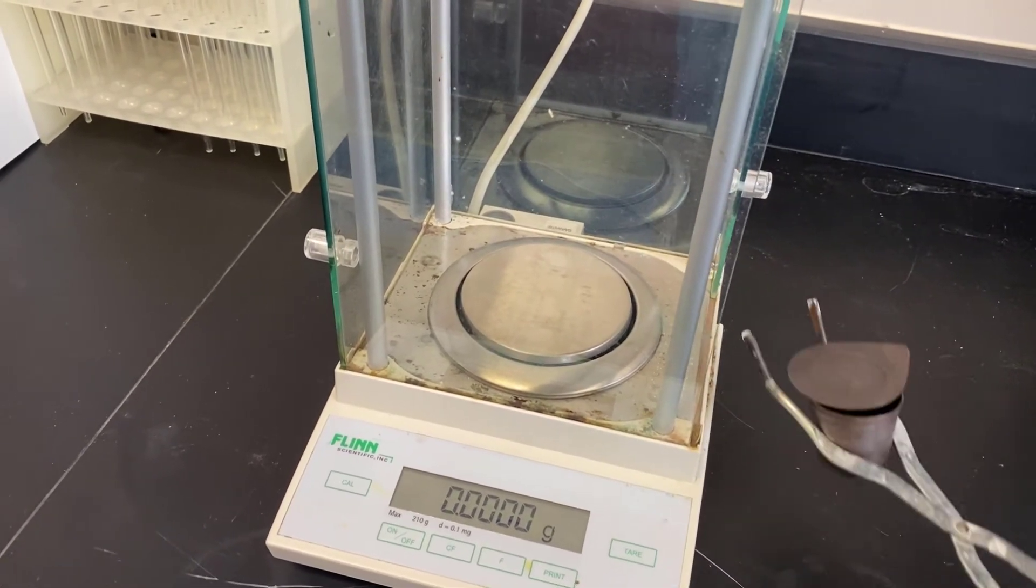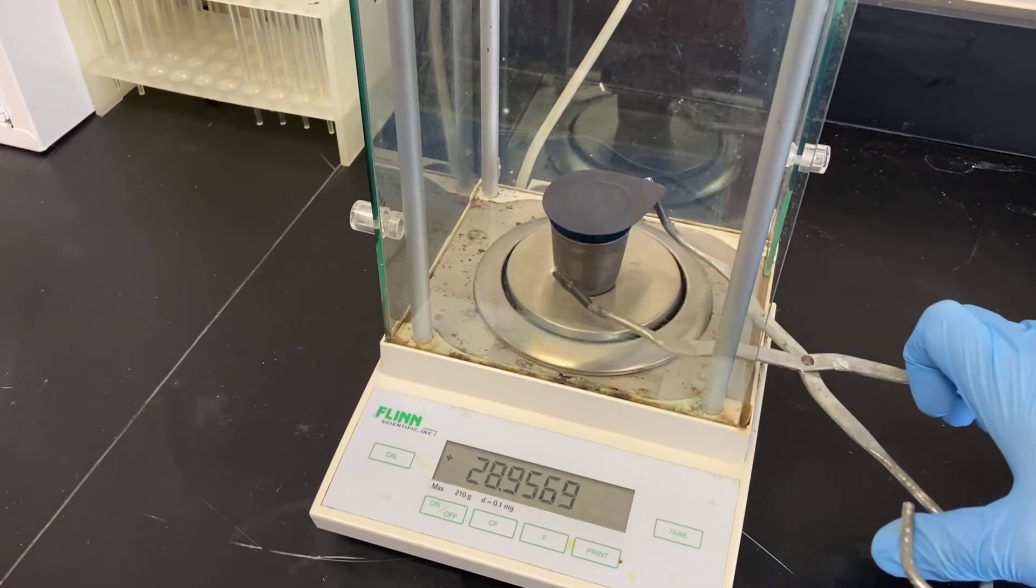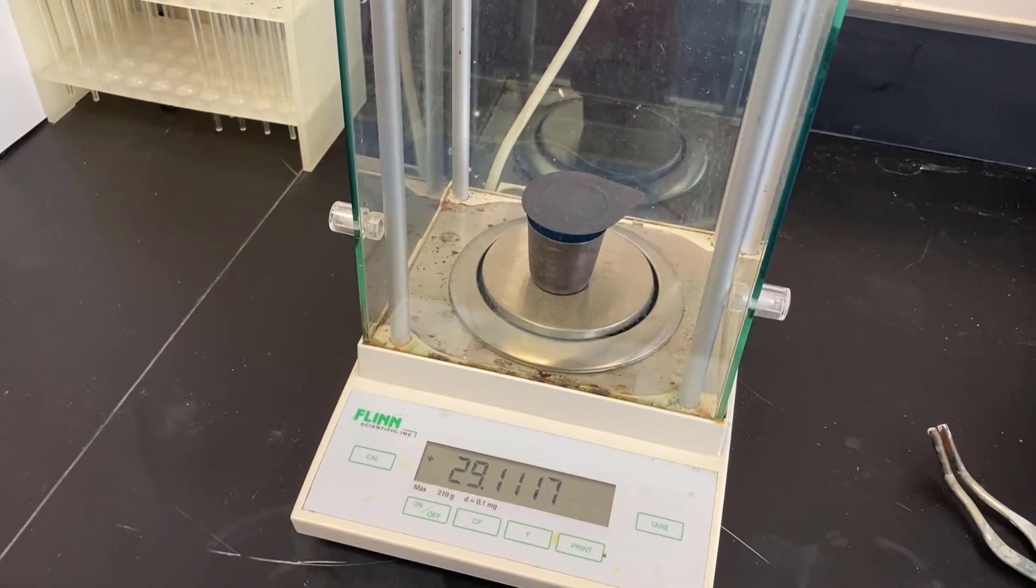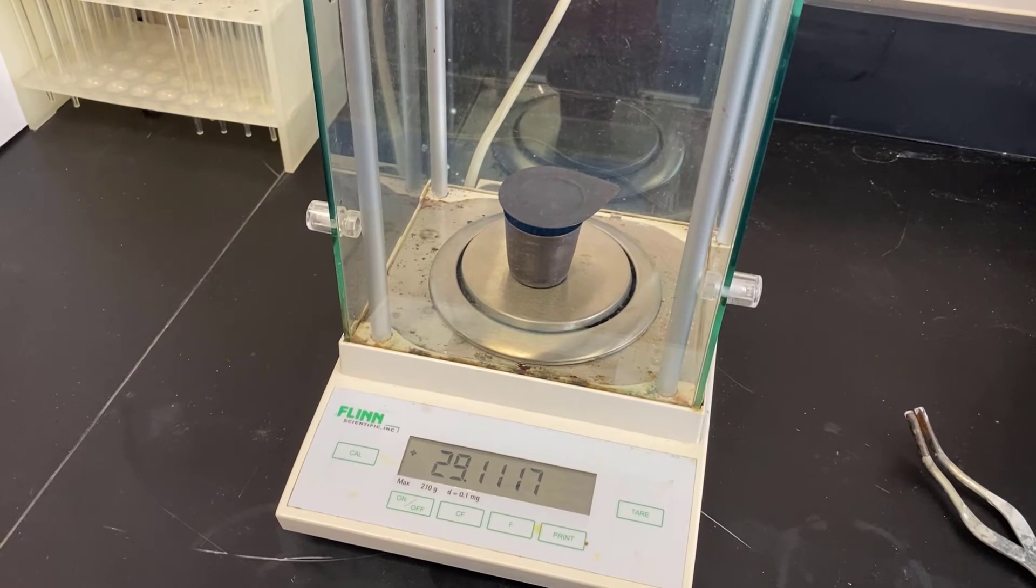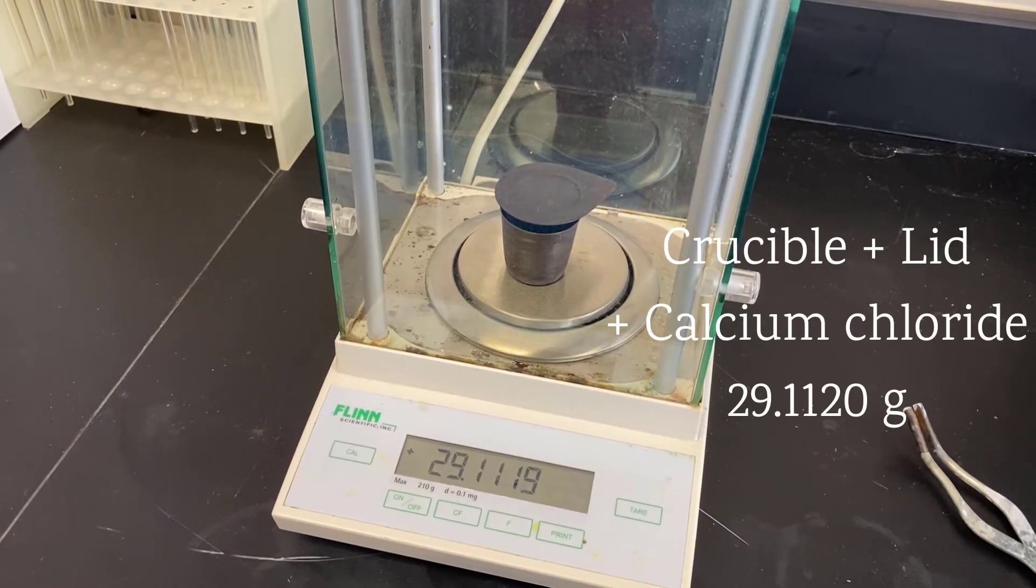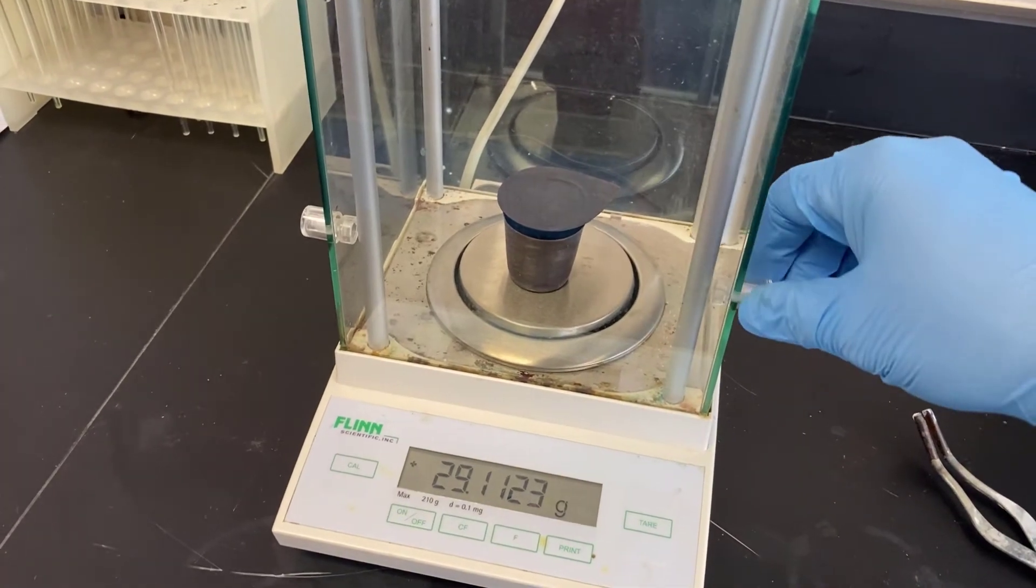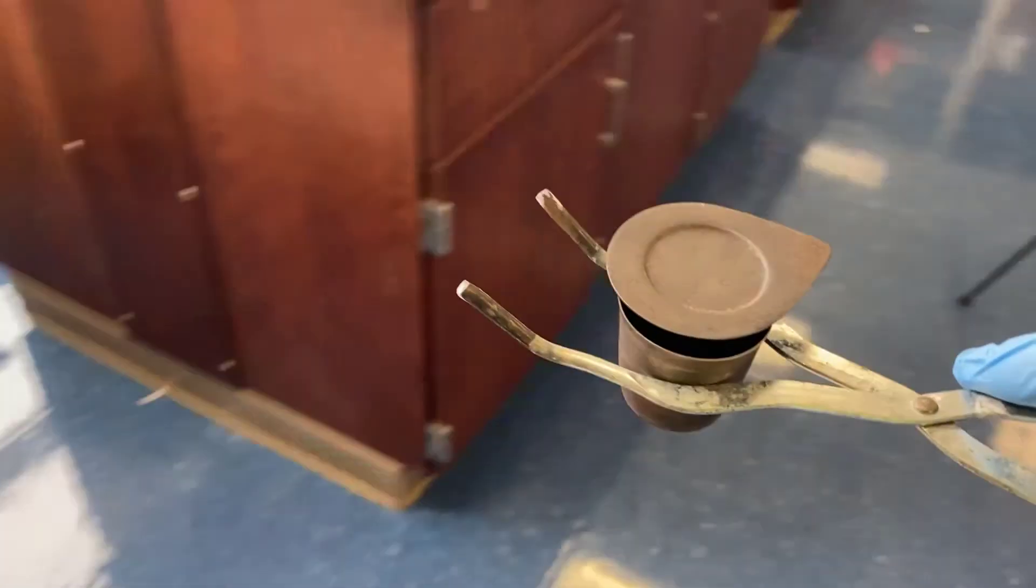If the mass is starting to go up, a few things might be going on. Perhaps the salt is absorbing water, and we just didn't heat it as thoroughly. Or perhaps an additional reaction is taking place because of contaminants. Or perhaps a decomposition reaction of some sort is occurring because of the heat. Some of the salts may produce things like hydrochloric acid.